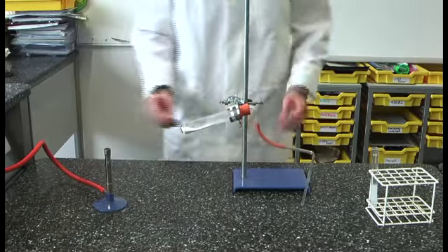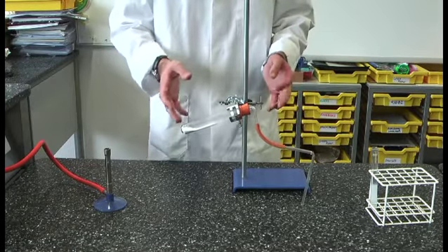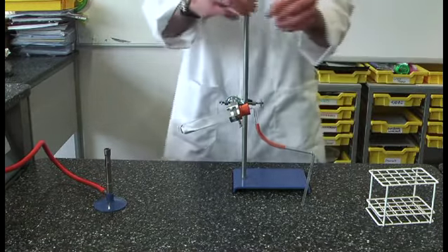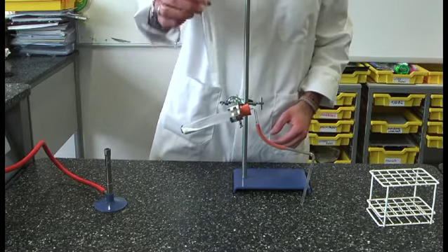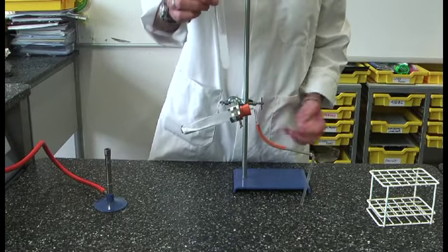So you're then going to turn your Bunsen off and you're going to allow your apparatus to cool. Now as you can see here, clearly the test tube in the lime water has gone cloudy.